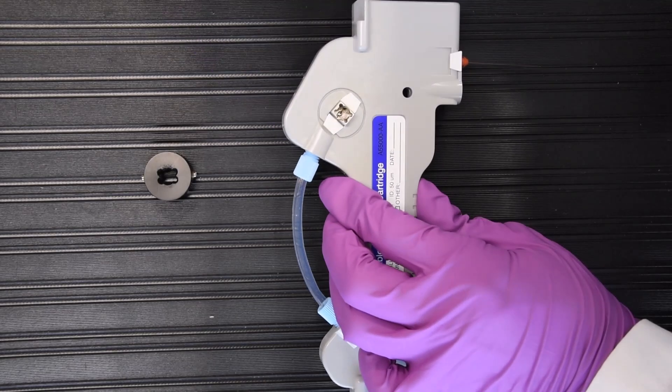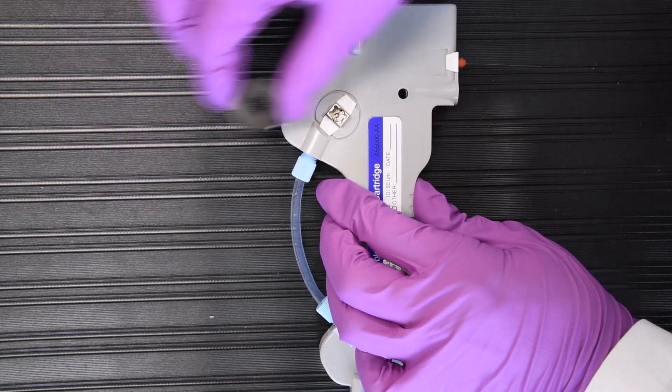Place the probe guide onto the metal LIF aperture and snap the probe guide into place.